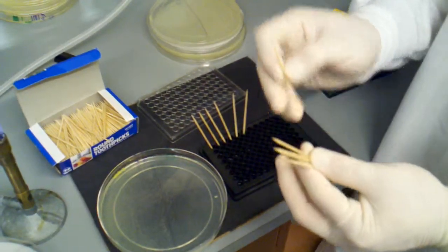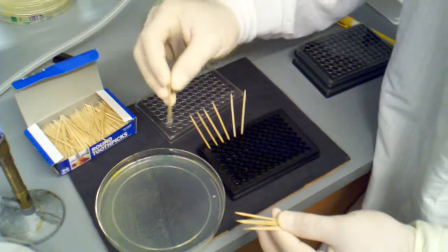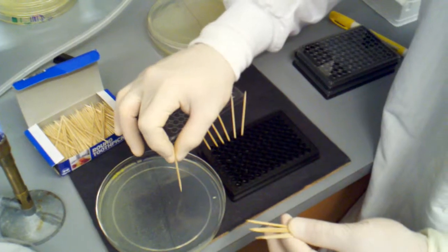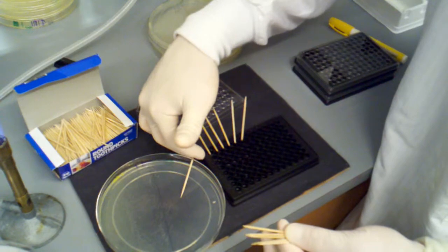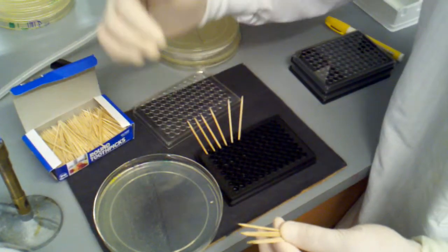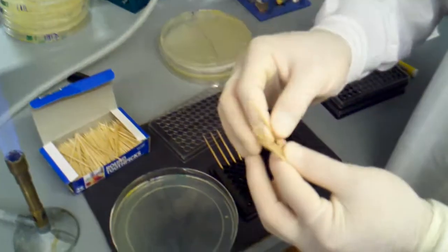Now another way to do this, if you have a lot of thick agar and you want to go a little bit faster, is you just stab the colony. See, this is not going to work because my agar is too thin.